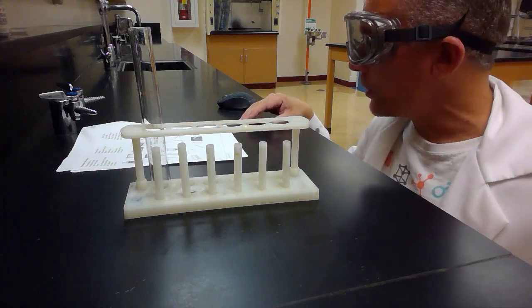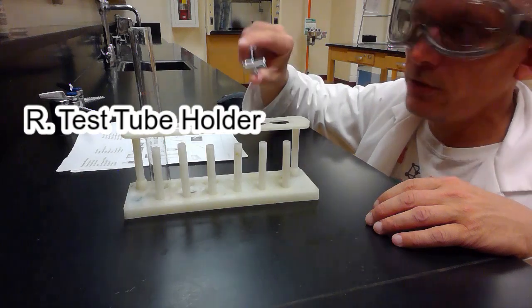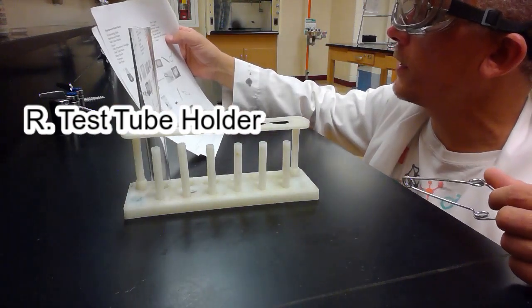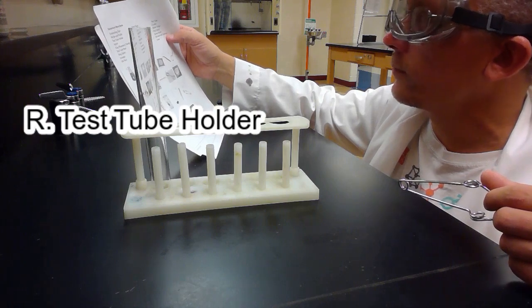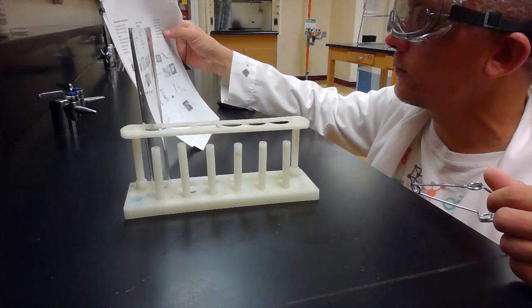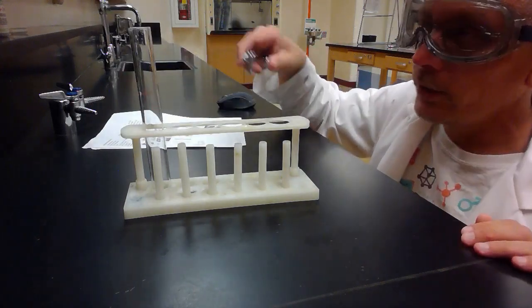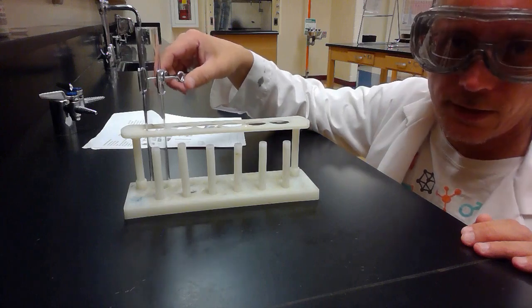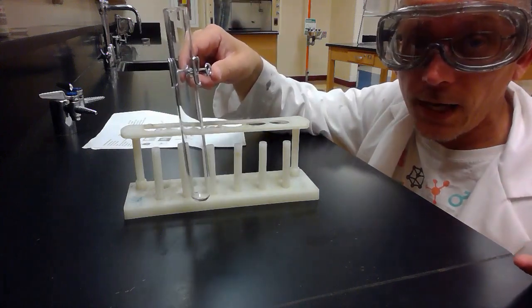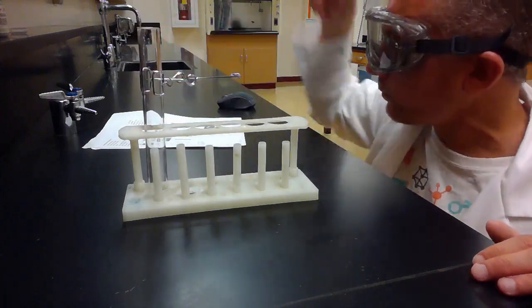And then we have picture R. Picture R is called the test tube clamp or test tube holder. I don't remember exactly what it calls it on here. Test tube holder, it calls it. And the test tube holder can be used, it'll go right there on the test tube, and you can pick up the test tube and easily move it. Maybe your test tube's hot. You don't want to pick it up, so you move it with the test tube holder.